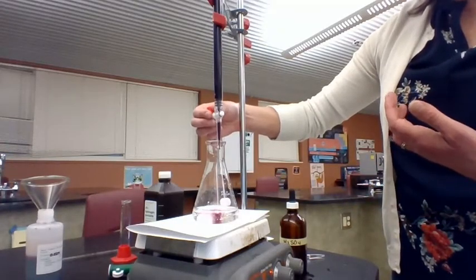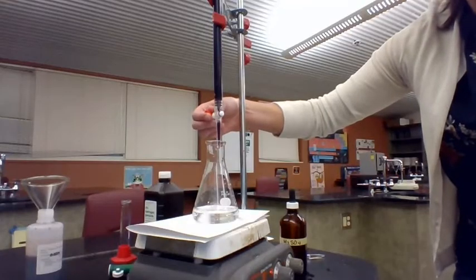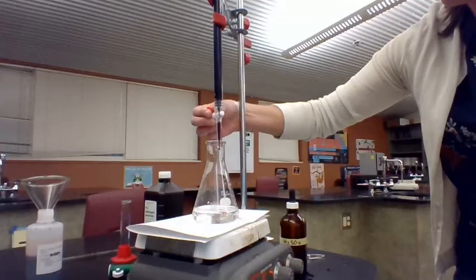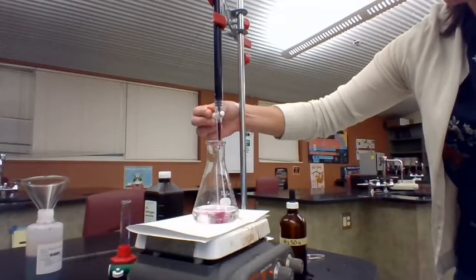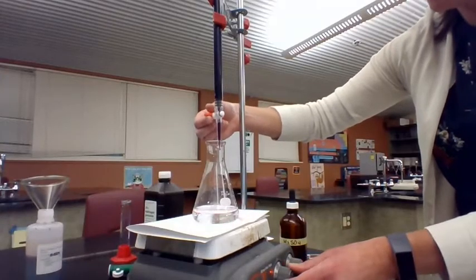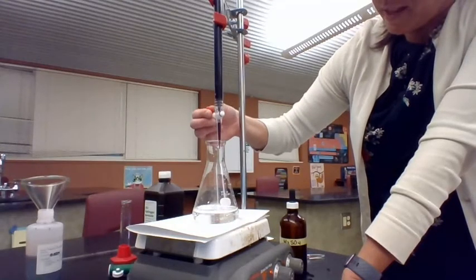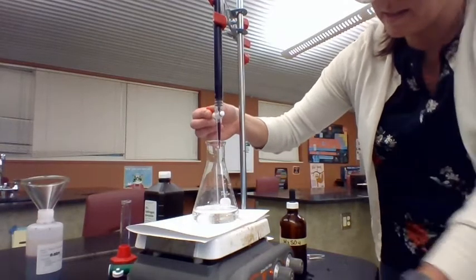I will know I've reached my end point when I add some permanganate and the solution remains just a little bit pink. This is one of those experimental techniques that you get better at with time — being able to turn the dial just enough so it drips slowly. When you go beyond the end point of your reaction, that's called overshooting it. So I'm trying to avoid overshooting — I want to stop right where my solution just stays pink. Notice I'm getting close to the end point because I can see my solution staying pink for a little bit.